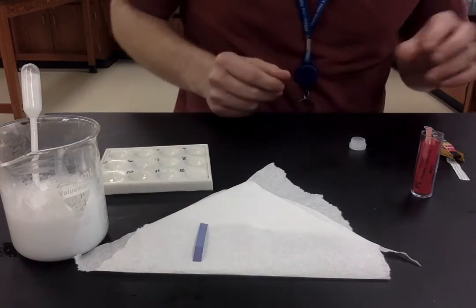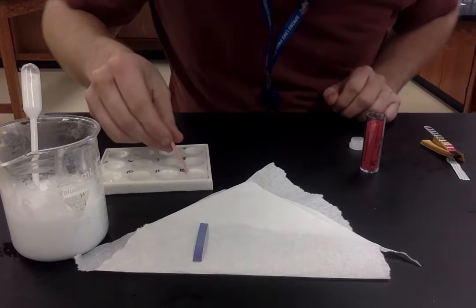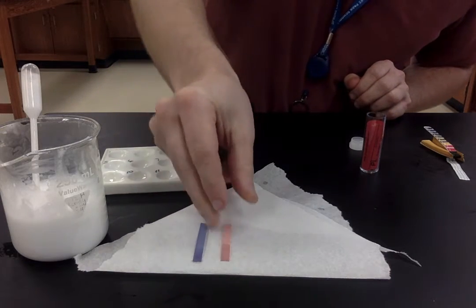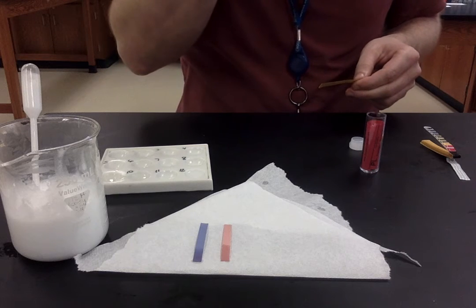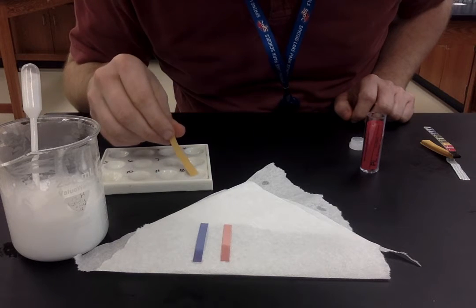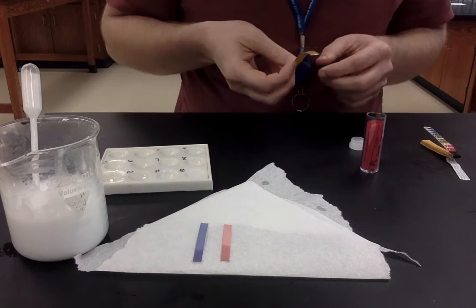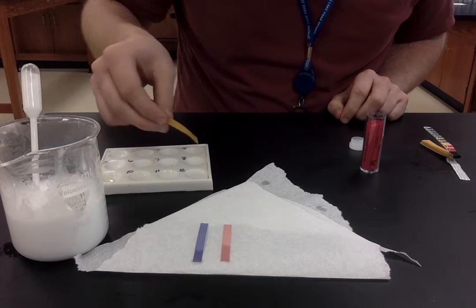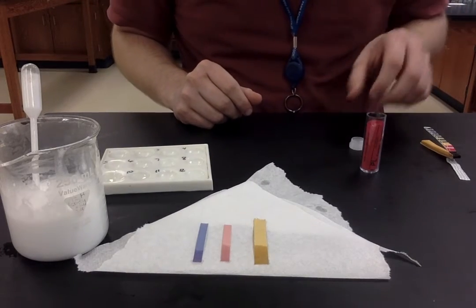Okay, so there's the blue litmus paper. Let's do the red litmus paper next. So let's do the pH paper. Okay, let that dry for a second.